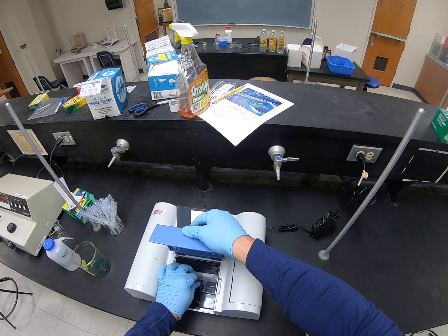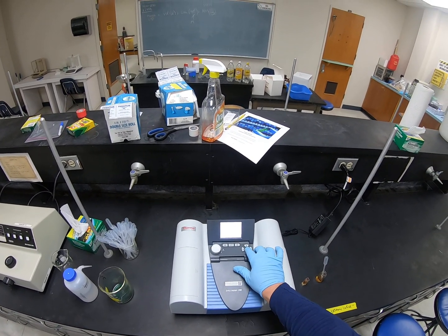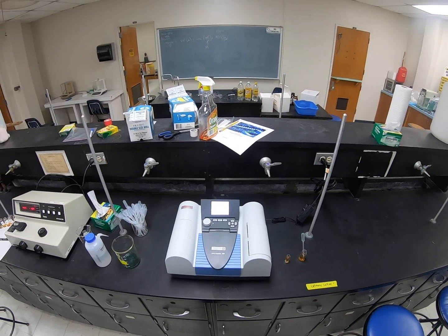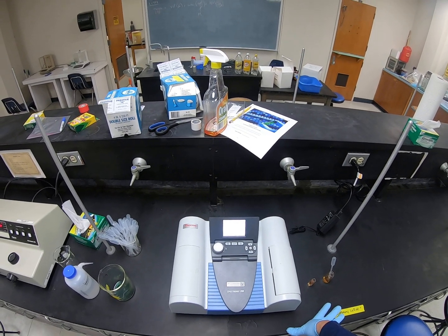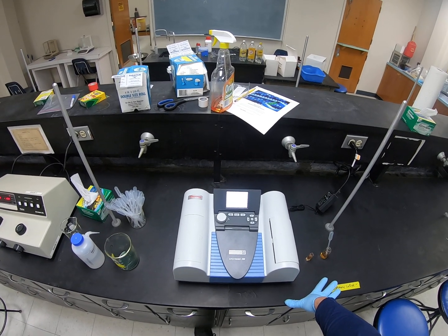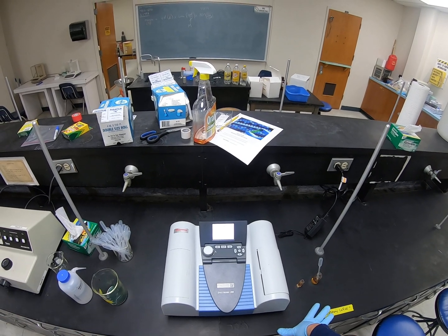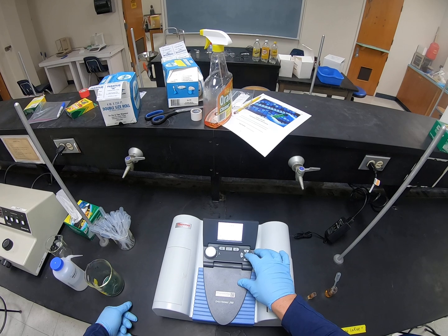First thing I'm going to do is I'm going to get a scan of water. So I'm going to put water in, and I'm going to go into scan mode, and I'm going to tell it to scan. And it's going to do a spectra for me and make a measurement for water. So I'm going to hit enter, and it's going to say scanning. And I'm trying to make sure my camera is kind of pointed in the right direction. And what we see is that there is a baseline here for water.